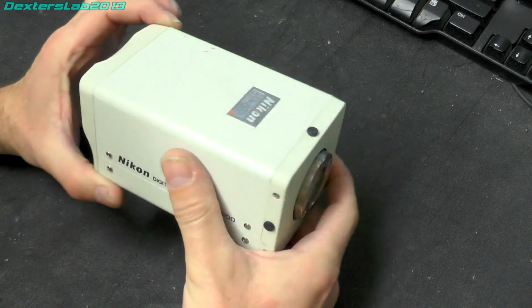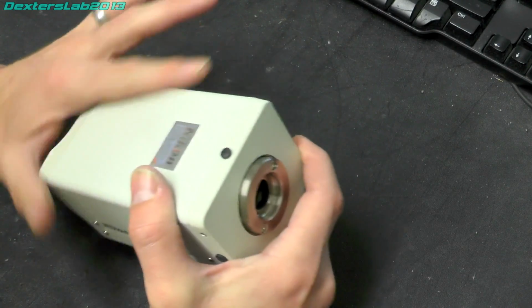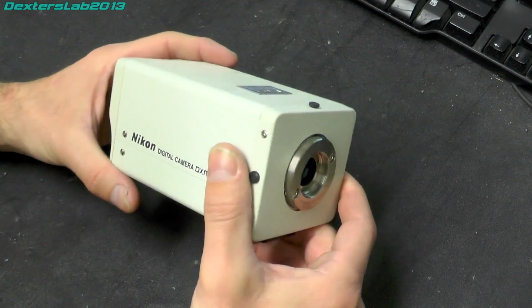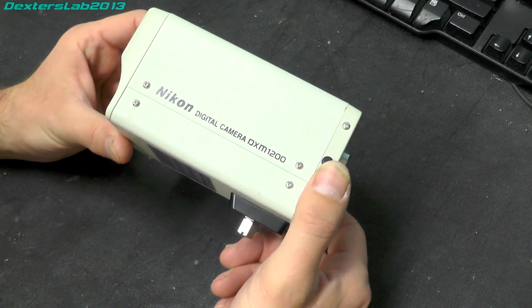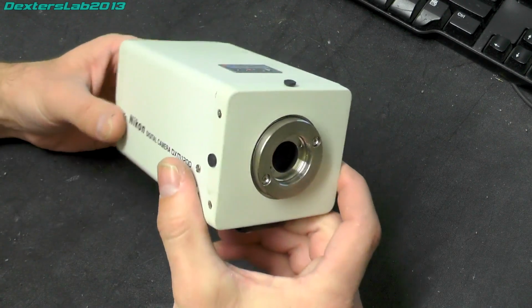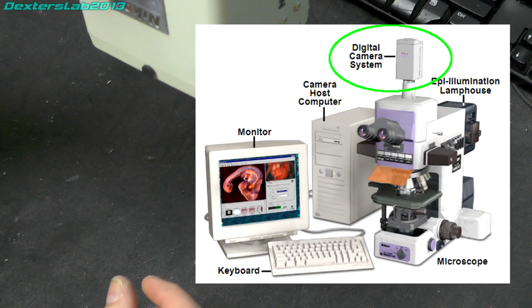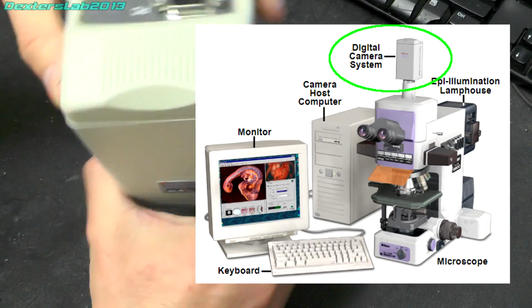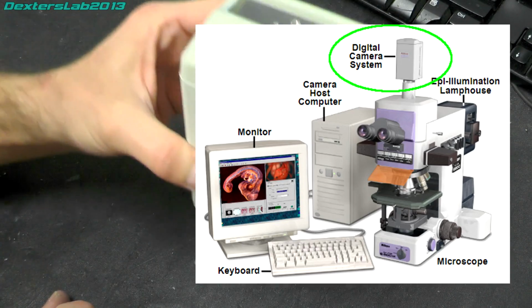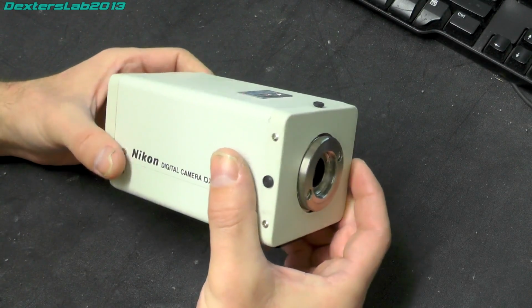This is a video camera which is used on a microscope to be able to capture digital stills of the microscope subject that you're looking at. So these are specifically designed to sit on top of the microscope. They'd generally be positioned above on a trinocular microscope, so you'd have the normal viewing, and then this would sit on top and allow you to take a high resolution digital photo.